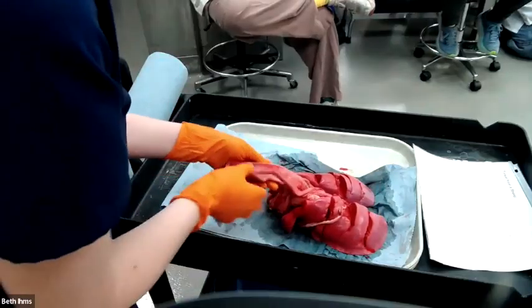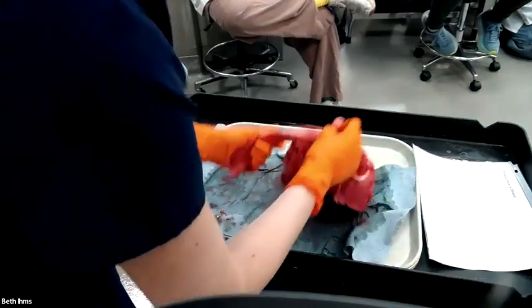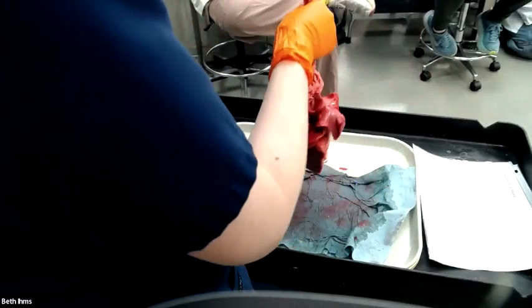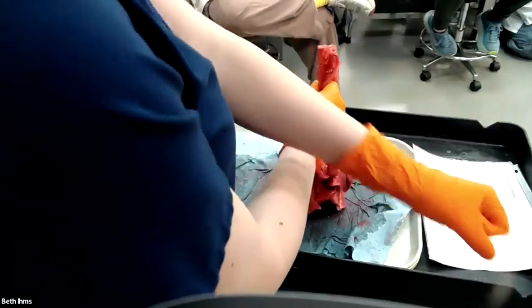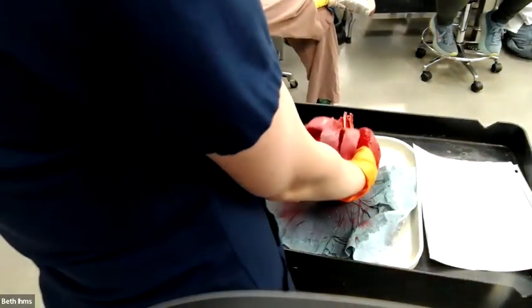Here is another tissue. We've got some trachea. We've got a little bit of esophagus. We've got some great vessels. This is called a pluck. It would be if it had the tongue still on. So pluck is from tongue to lung. That all comes out as one piece and we examine it. Heart is gone. So here we have some lungs. They have been bread loafed. So this is how we examine large tissues.